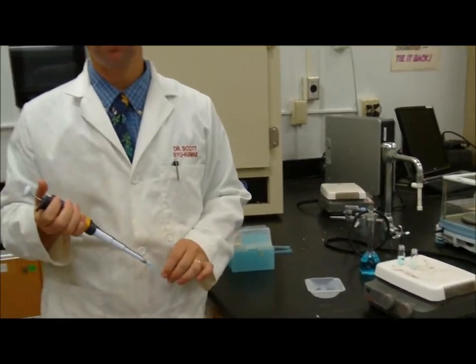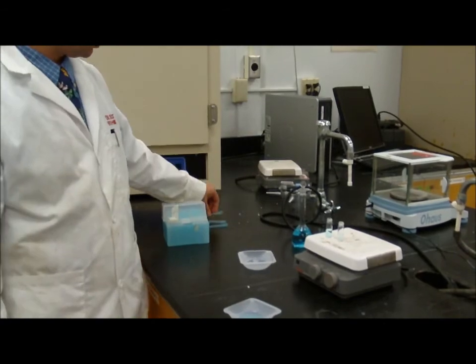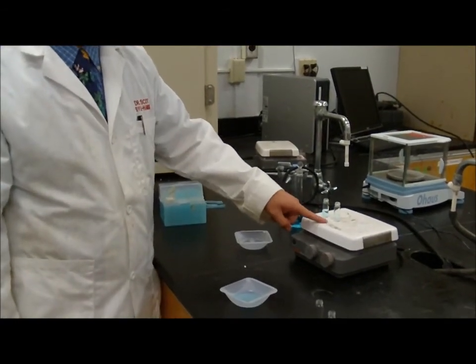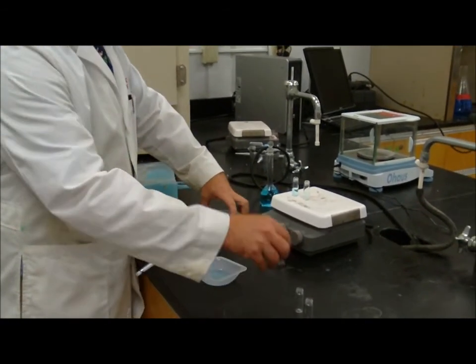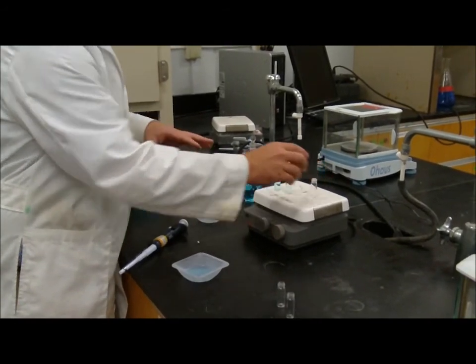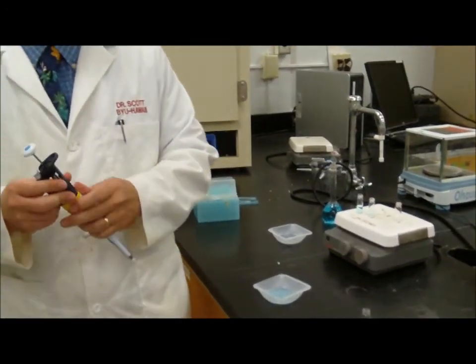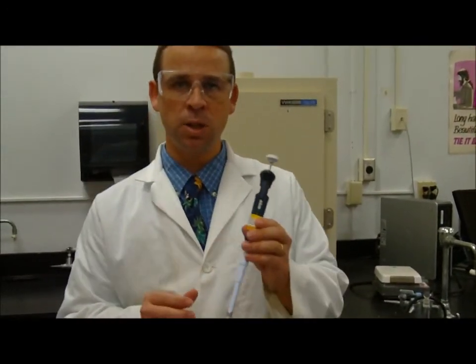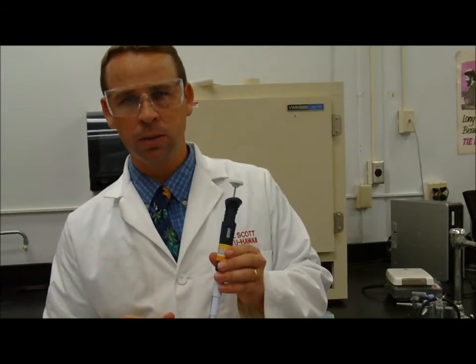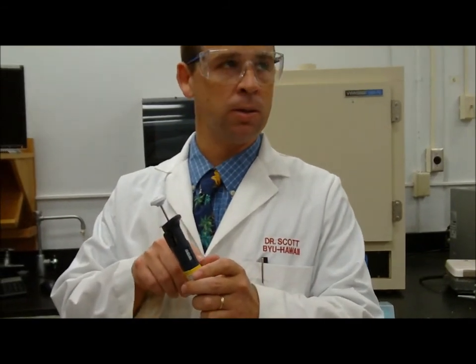And you can see the difference, right? So that's why we're working with copper sulfate, just so we can see the difference. So I made 100% here, I made a 50% here. I can put a little bit of water into one of these bottles just to show you what a 0% looks like, right? And then I can make a 25% as well. Now let's say I just want to make 1 milliliter of a 25%, okay? So if I want 1 milliliter of 25%, this is 1 milliliter, right?